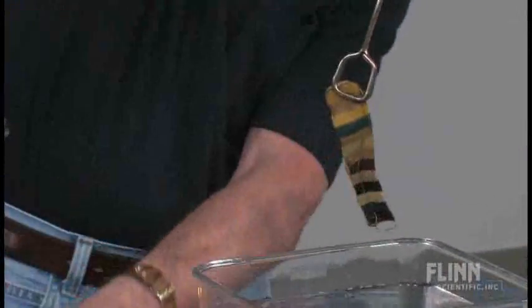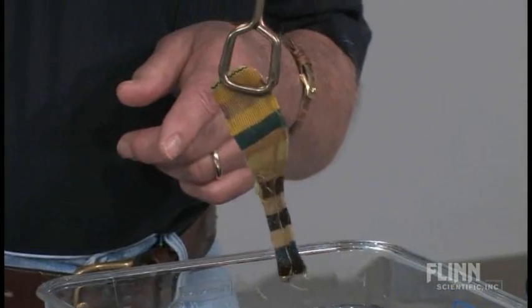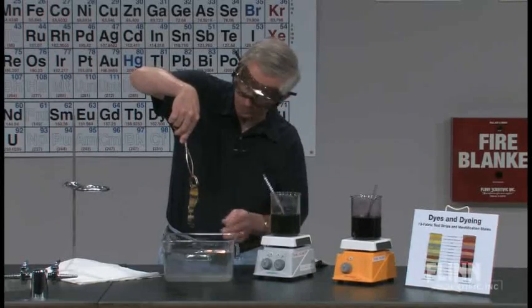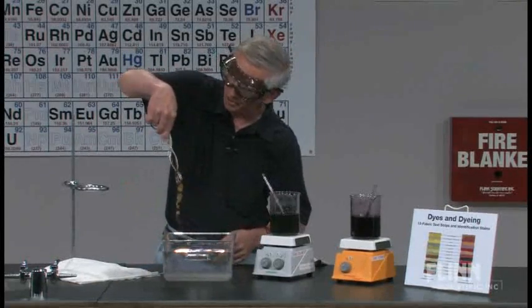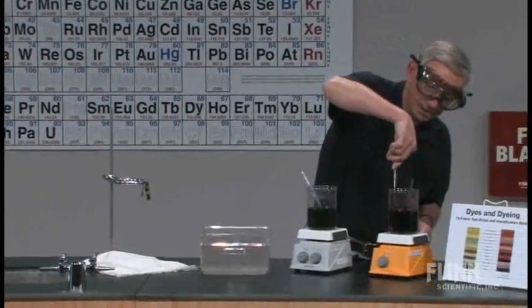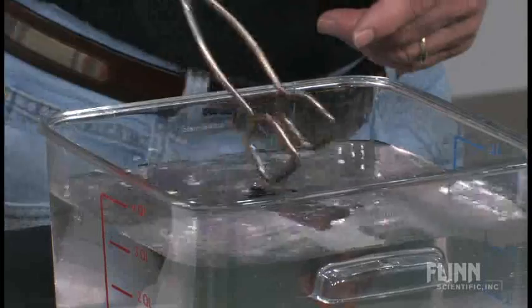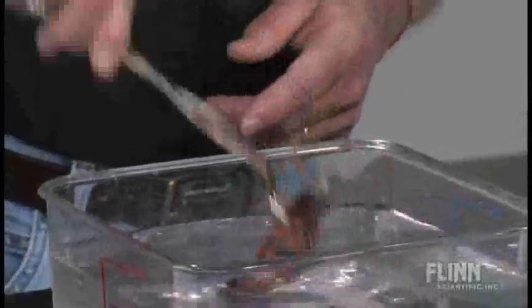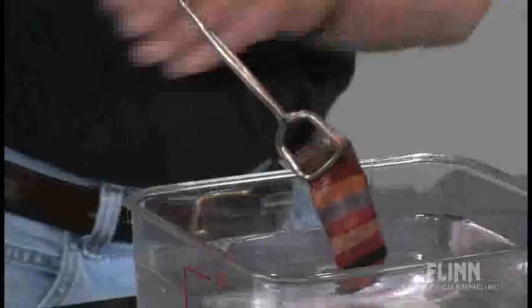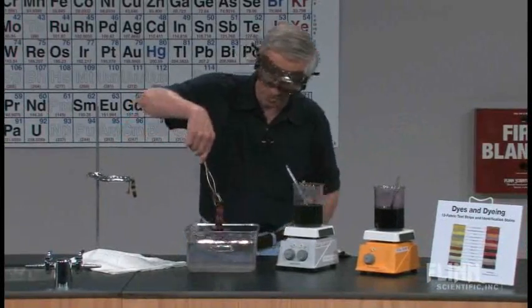You can see that the colors are nicely developed. They're nice and bright. What we're going to do is set them on an iron ring here and let them dry. Get the other one. Hold it by the top. Notice that on my finished samples, the top has a little black strip — that's how I know which way to put it.